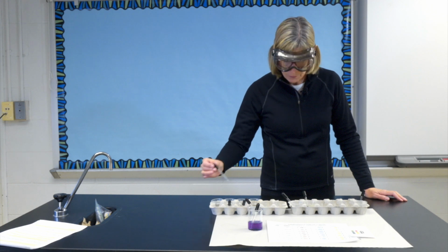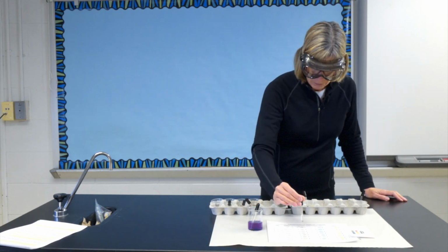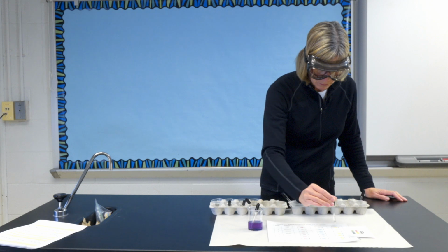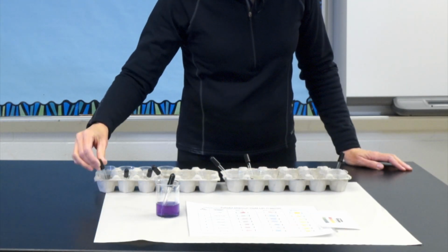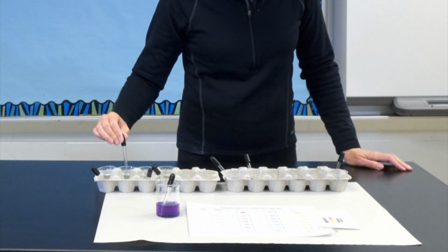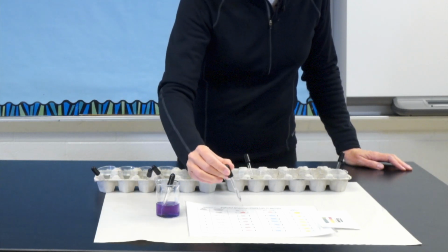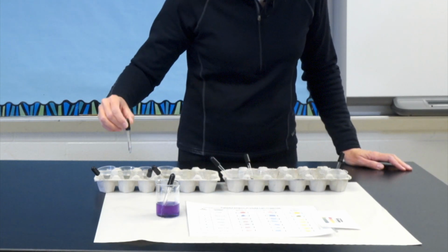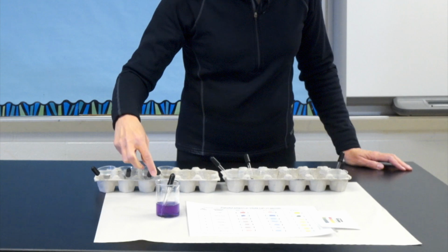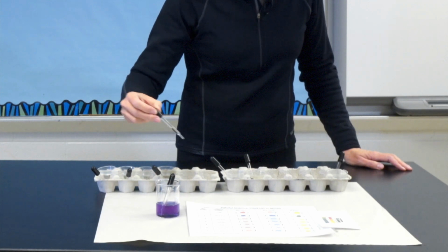First is vinegar. Second, the baking soda. Third, soda.